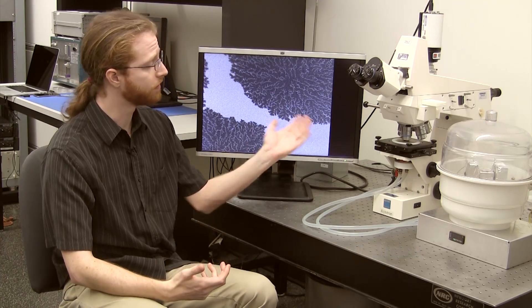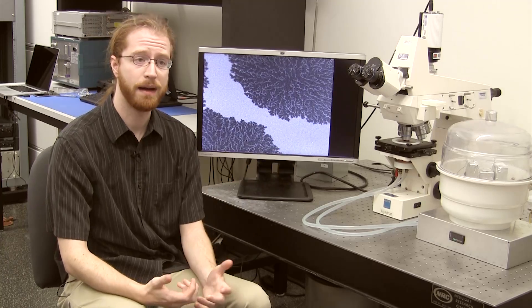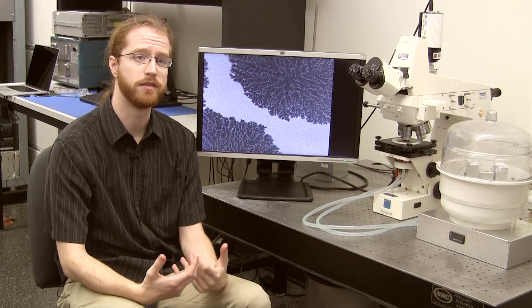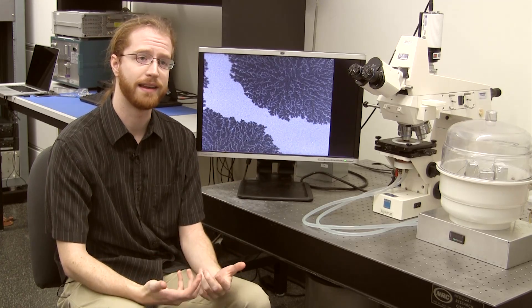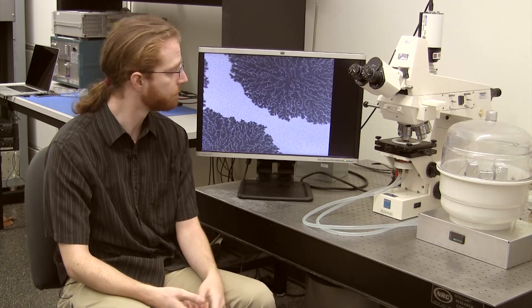I'm Ben Buford, a graduate student in the Applied Magnetics Lab at Oregon State University. One of the characterization tools we have in our lab is this Kerr Effect microscope. It's an optical microscope that uses polarized light to image the magnetization of a thin film.